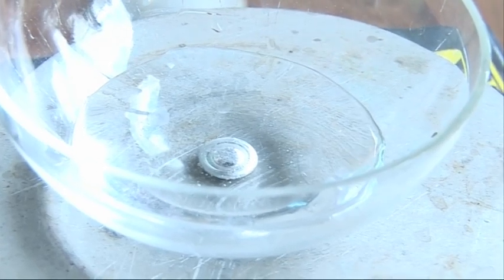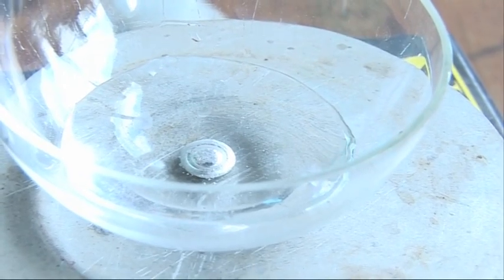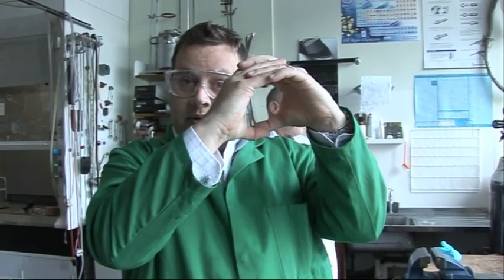We've made gallium sulfate on the surface. The surface tension has got higher, and it's pulled up into a nice ball. So that's the first step of the beating heart. What we've seen is the gallium, which was relaxed, flat on the surface, has pulled up really quite sharply. And that's the first stage, or the in-beat of the heart. Now we've got to make the heart relax.